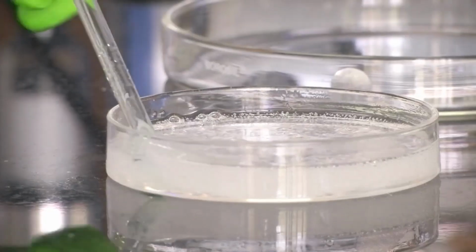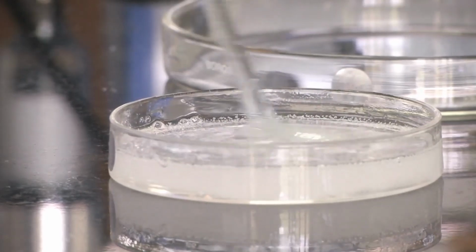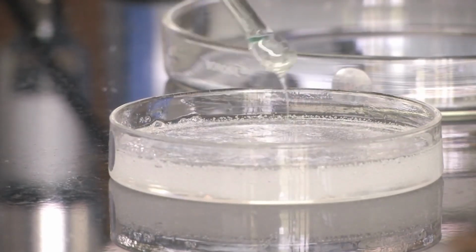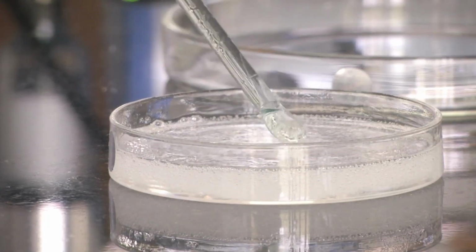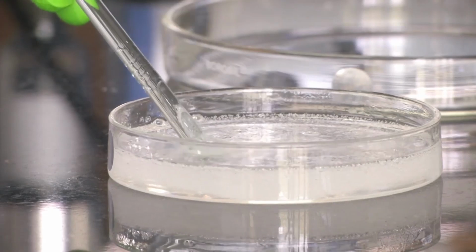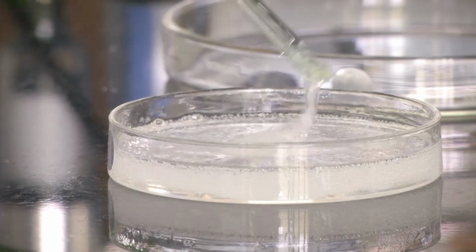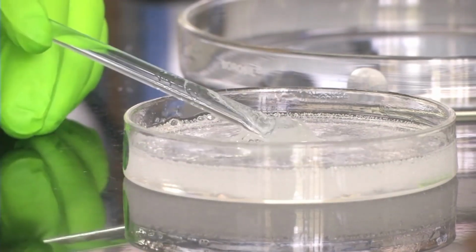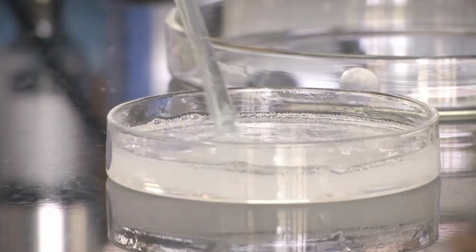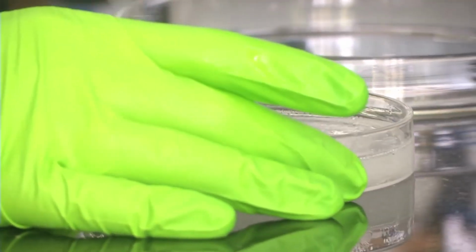So we have now thoroughly mixed the PDMS and curing agent for 10 minutes, more than 10 minutes actually. You can see the mix now. It is full of bubbles. You cannot use it directly. Actually, this is the mix we need to make the mold, and this is the same layer that will form as a thick solid once we cure it. But lot of bubbles are there inside, which is not desirable. We need to remove all the bubbles. So we have thoroughly mixed the PDMS and curing agent for 10 minutes, and the mix is now ready.